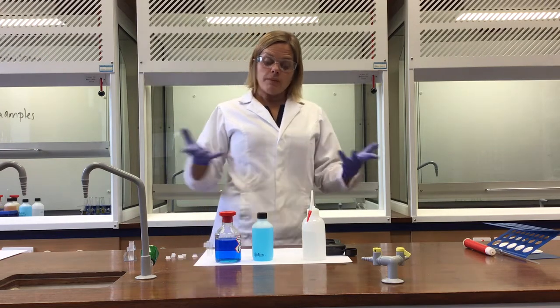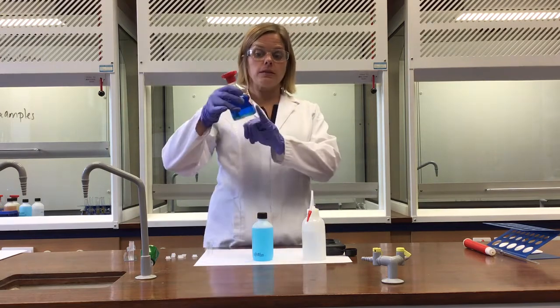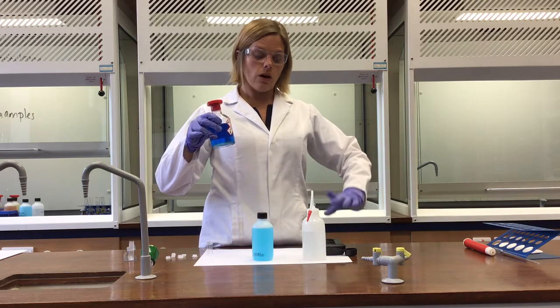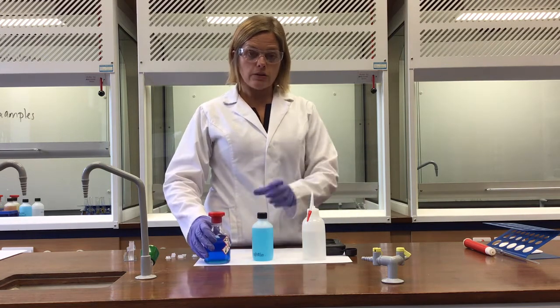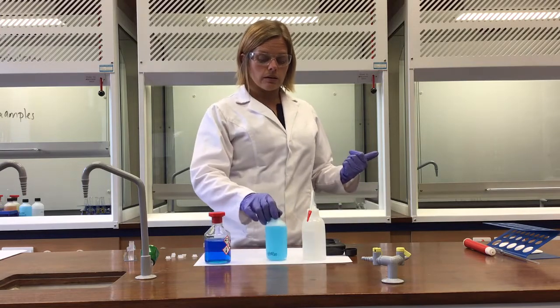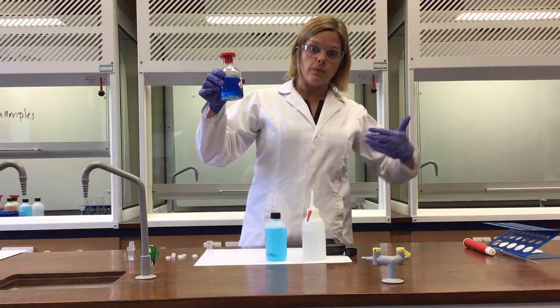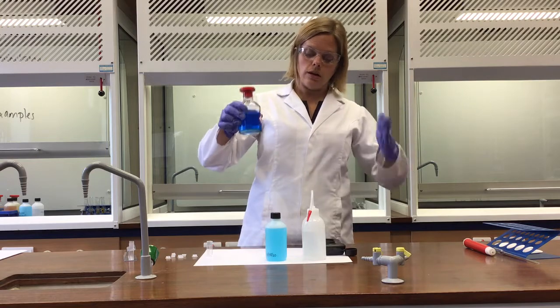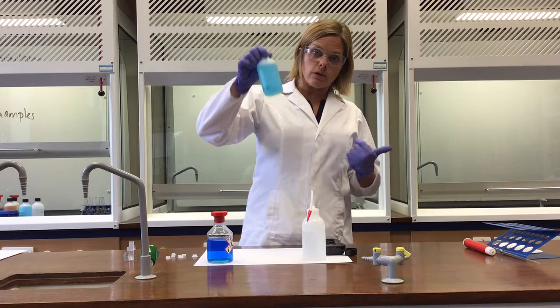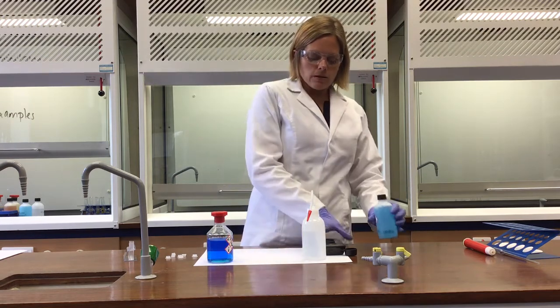So the method of colorimetry works as follows. Take some known concentrations of that particular substance and record the absorbance of those concentrations on the colorimeter. Then finally, using the same machine, take a sample of the unknown concentration and record that. Plot the data from the known concentrations so that we have a relationship between the concentration and the absorbance, and then use the graph to work backwards and find out the concentration of the unknown from its measured absorbance. So this is how we do this then.